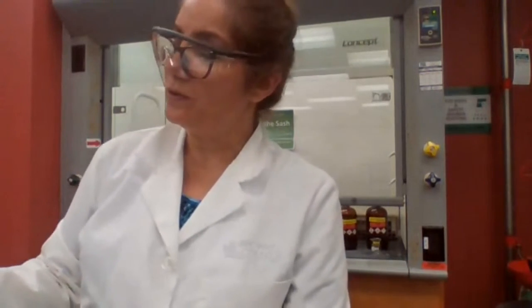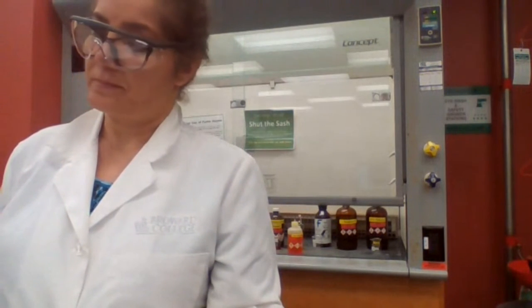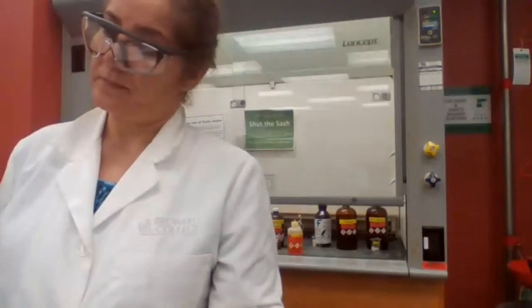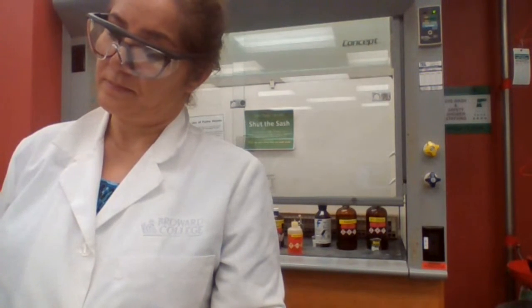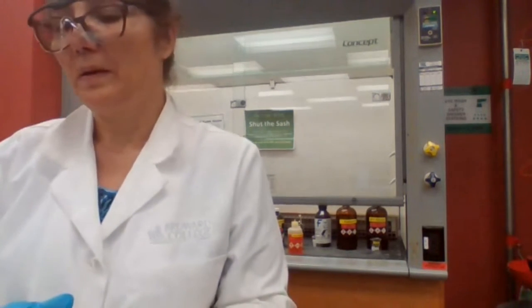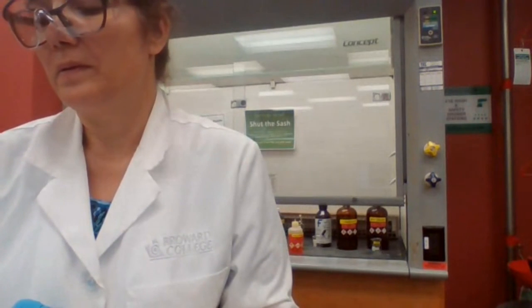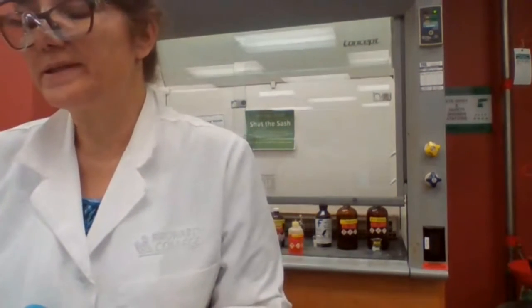Bromination is next. So bromination of phenol, what do you expect? Decolorization? Okay, let's see.